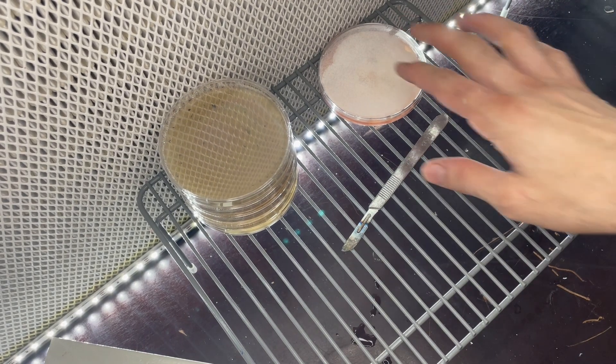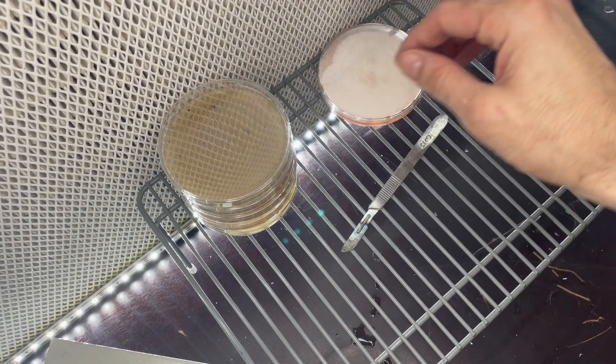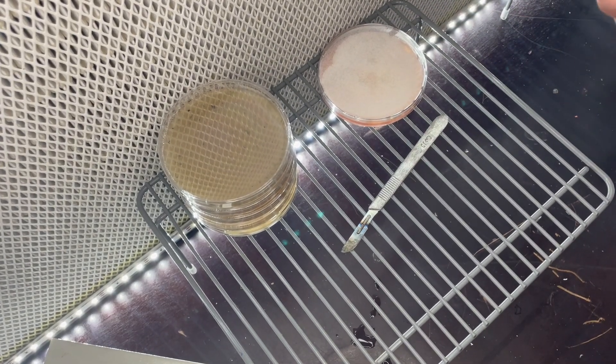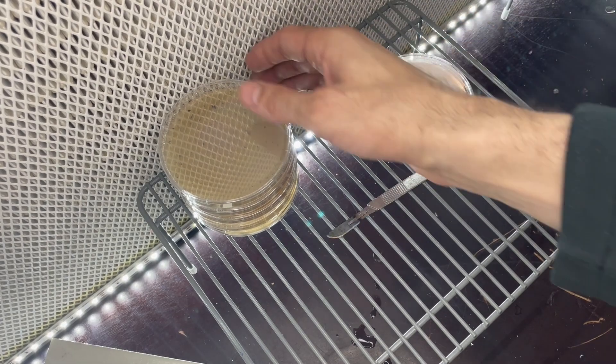Today we're going to be working on doing transfers from one plate to another plate. Say you want to expand this culture out, you're looking for a particular type of growth, this is how we're going to do it.